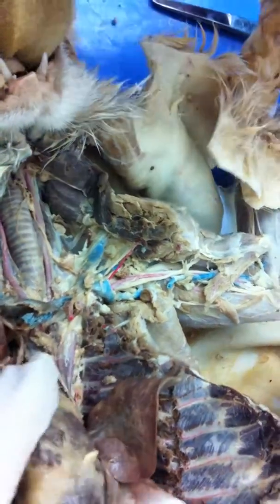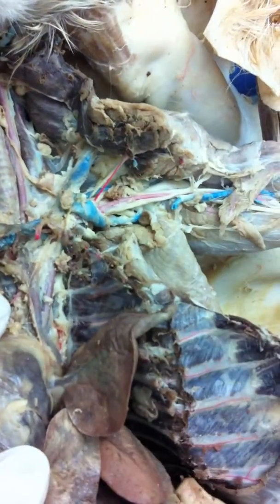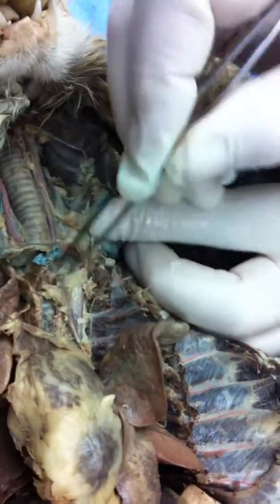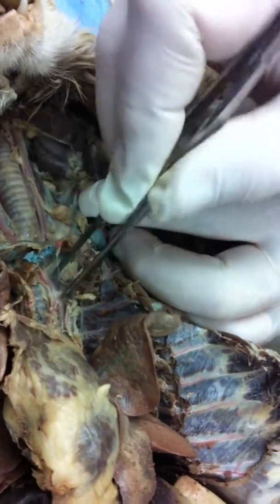Okay. Y'all see the difference there? This one's small. See it? It goes to the right. This one comes up the middle. It's a little bit fatter. That's brachiocephalic, and that was the left subclavian. Now, that one is brachiocephalic. Pretty quickly, it's going to start giving rise to some branches, isn't it?